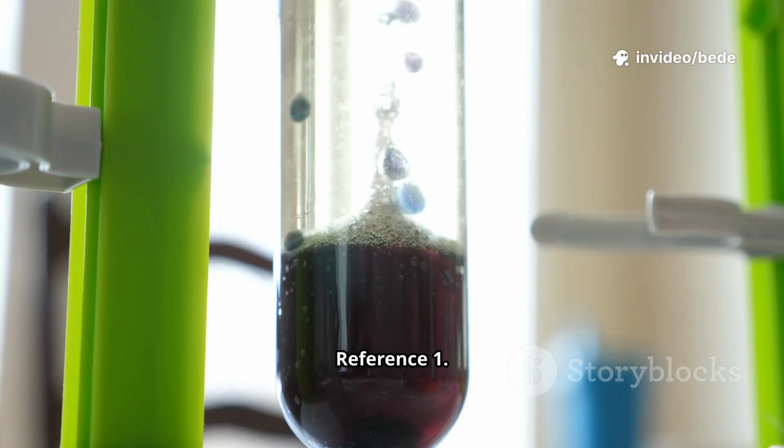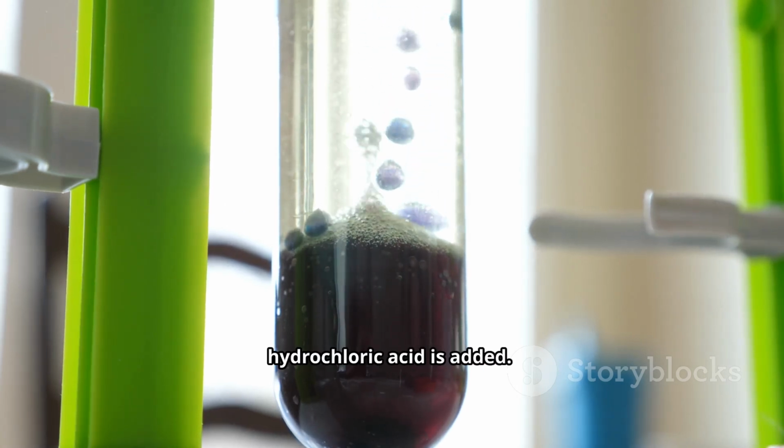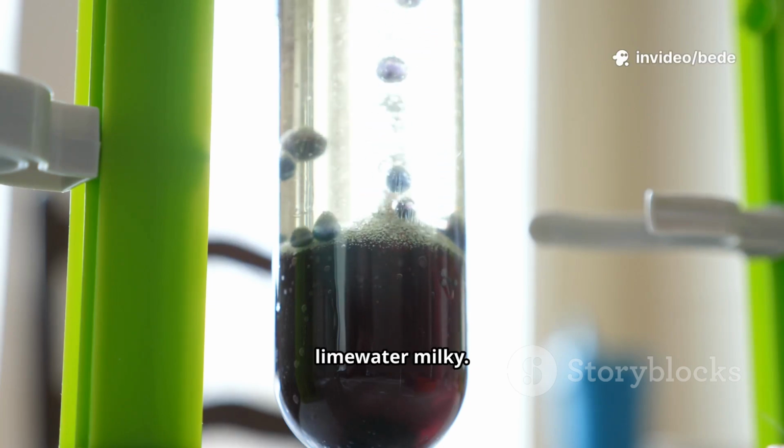Summary for quick reference: 1. For carbonate ion, carbonate shows effervescence of CO2 when dilute hydrochloric acid is added. CO2 is colorless, odorless, and turns lime water milky.